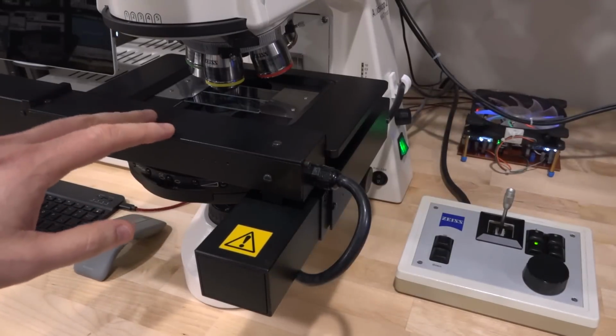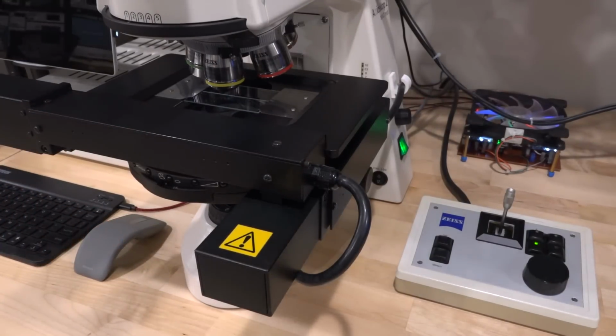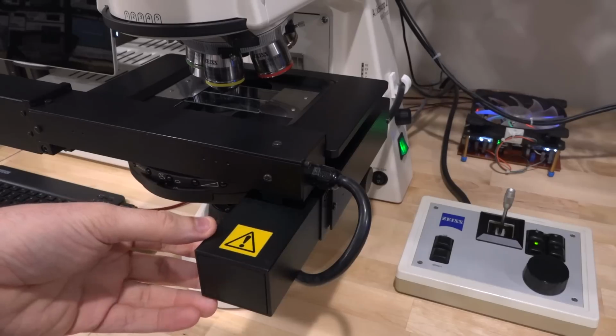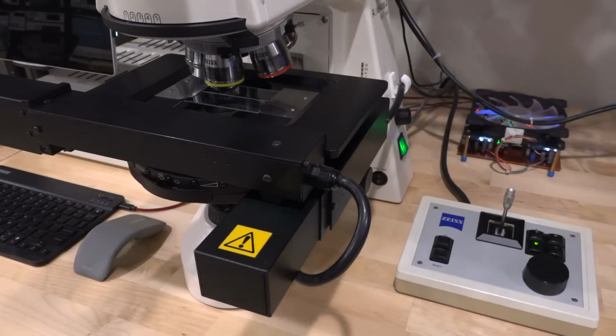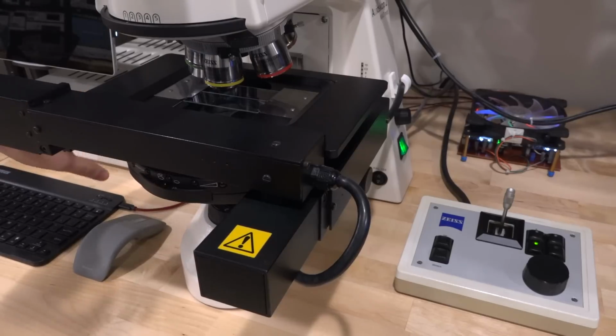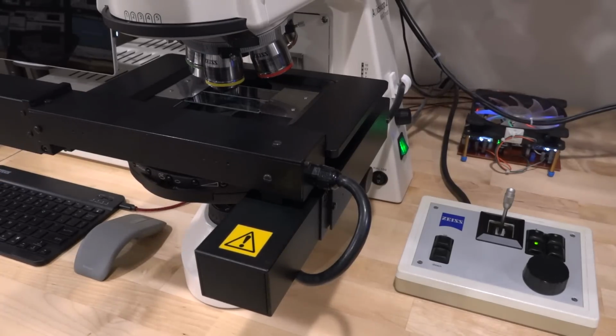Now, motorized XY stages of microscopes can be extremely expensive because these are servo-based with very, very fine encoders, allowing it to move in micrometer steps, even sub-micrometer steps, as we will see. As a result, if you want to buy a new one, it's going to cost thousands of dollars. Now, I found a broken one that I managed to repair and put together. It came with its own joystick. It also has a controller box, which is back here. We're going to take that apart and take a look at it as well. And all of those have to work together and be compatible.